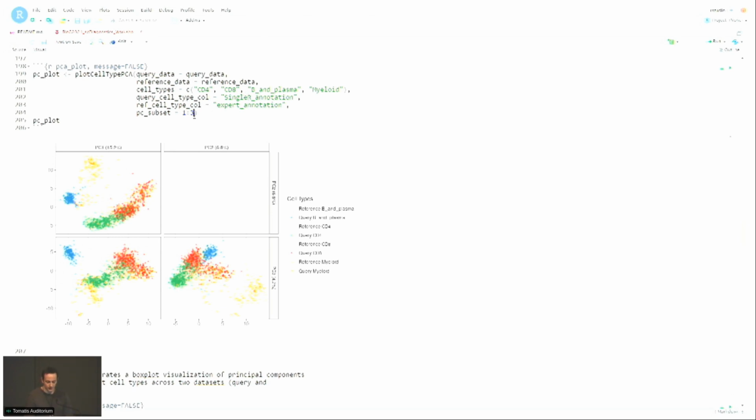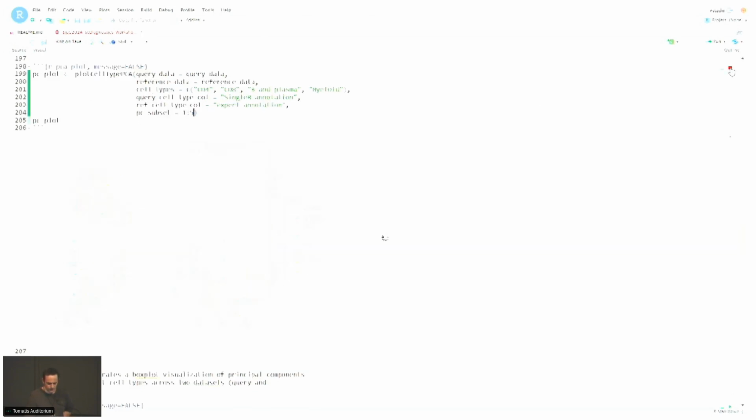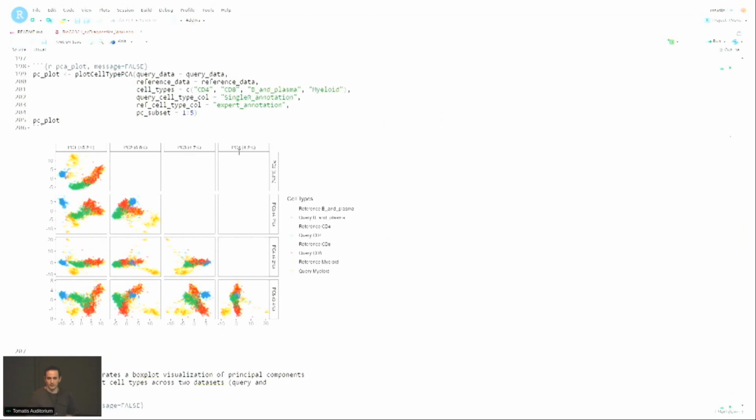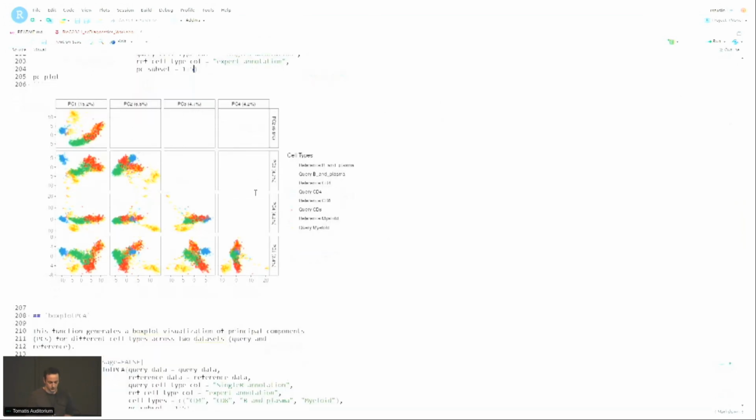If you want more PCs because you want to check, I think up to PC 10, there's quite a bit of variation that is explained in this data. So for example, if you want to print the first 5, you can adjust it to your liking. Okay.